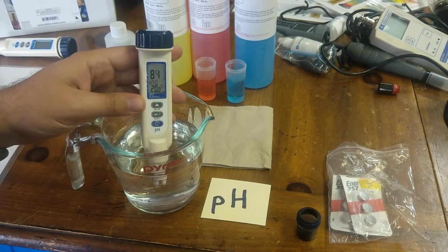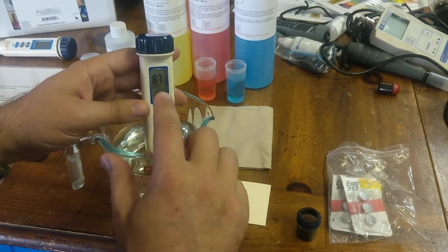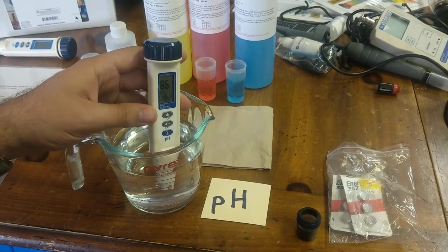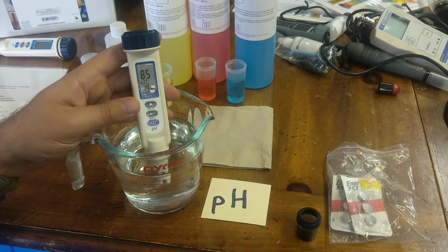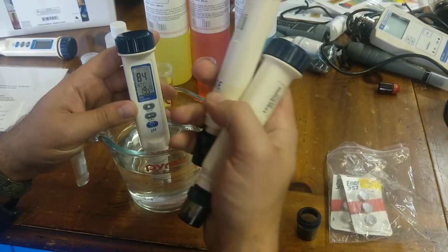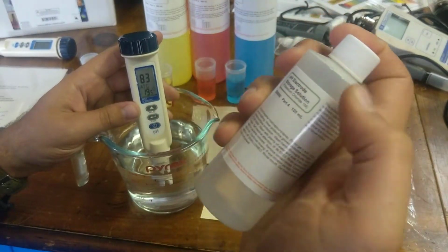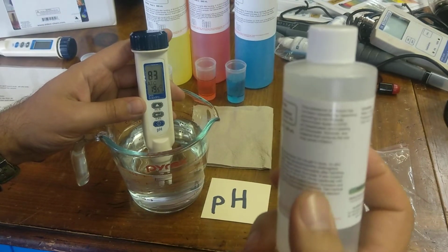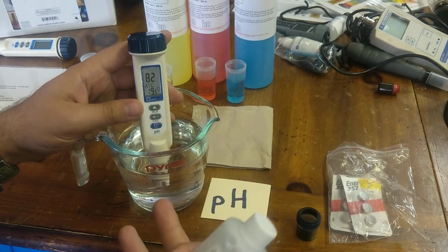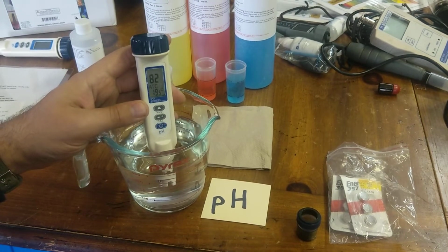What I'll do is I'll gently swirl here, and then you can read what the pH is. In this case, it's 8.7, it looks like. You may want to wait for it to stabilize. Now, it's very important before, I've already done it with this one, but with all of your pH meters, you'll want to just soak them in a KCl solution, which is this right here, potassium chloride. And this will basically prep the probes so that they're soaked and ready to go.